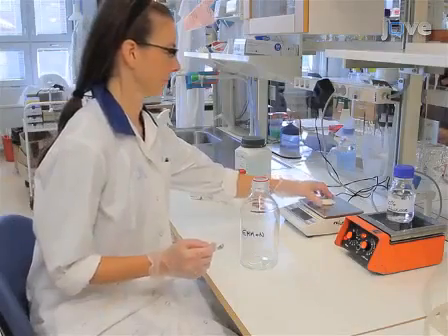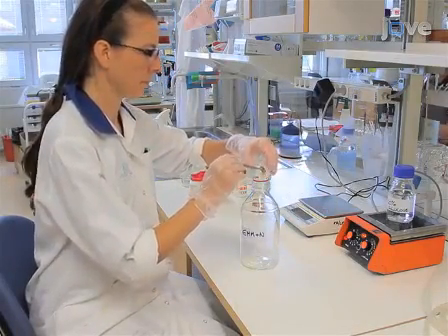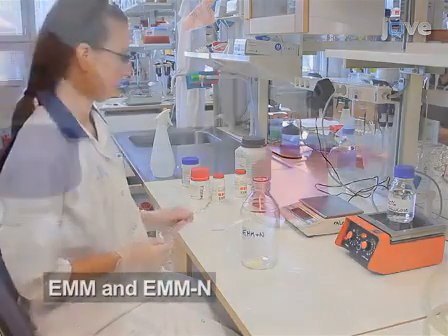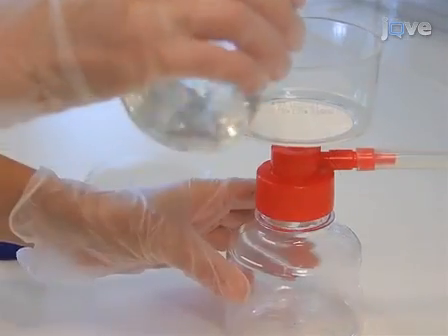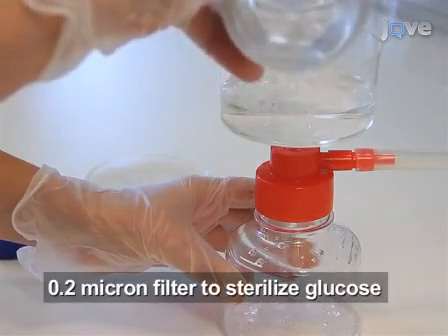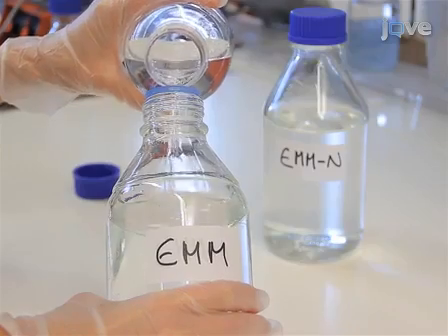To culture fission yeast, begin by preparing Edinburgh minimal medium or EMM and EMM without ammonium chloride. To reduce autofluorescence, rather than autoclave, use a 0.2 micron filter to sterilize the glucose solution and add it to the autoclaved media.